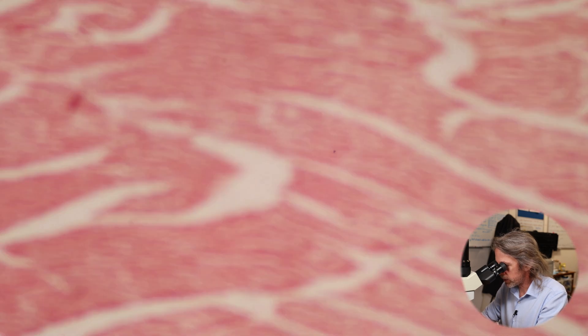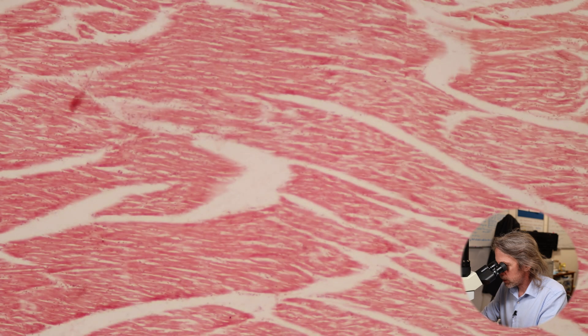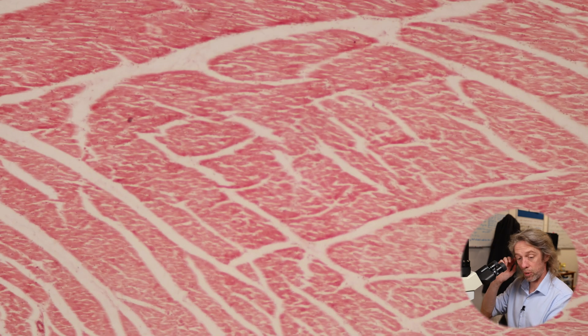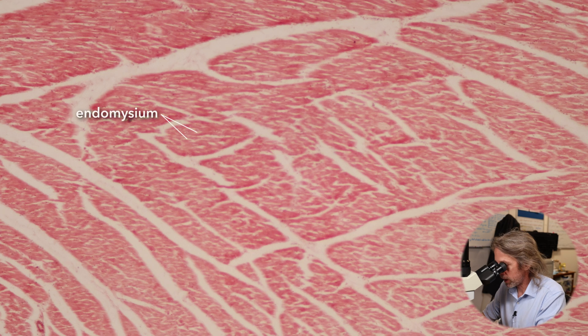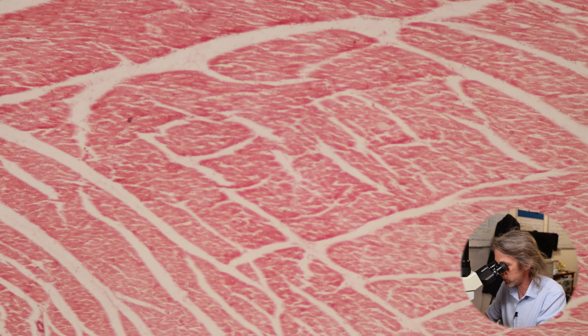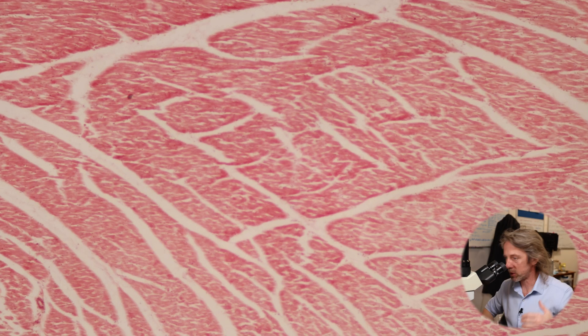Skeletal muscle is a muscle you choose to use to make movements — it typically moves bones but can also move things like the tongue. In terms of similarities, the cardiac striated muscle of the heart is also organized like skeletal muscle: myocytes wrapped up by connective tissue into fascicles, with connective tissue around the cells — the endomysium — and connective tissue around the bundles of cells — the perimysium. We can see some fibers cut in transverse section and others running more longitudinally.